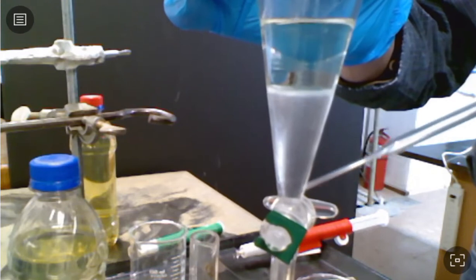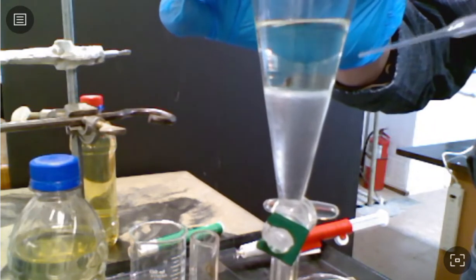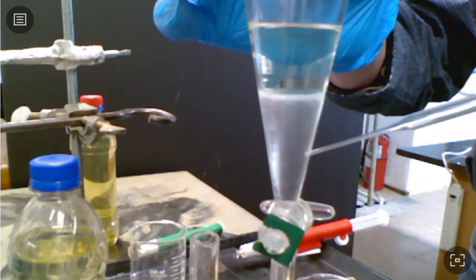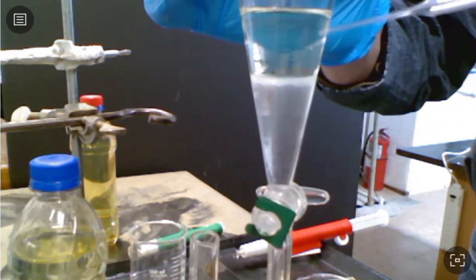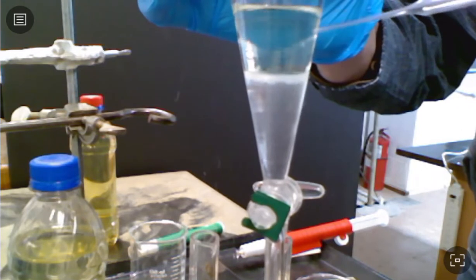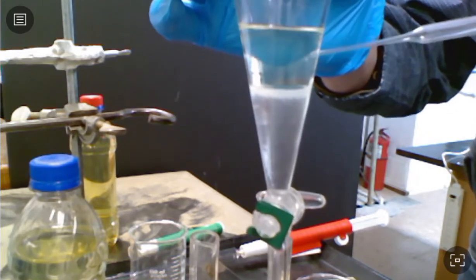Now you can see it really easily. That's our water layer there, and that's our gasoline layer. What's going to happen, the ethanol that's in this gasoline layer here, it's going to really want to be in that water layer. And so when we invert and shake this, that top layer is going to move from being a large volume to being almost no volume whatsoever. It'll just be a tiny bit. And that's because most of what's up here is ethanol.